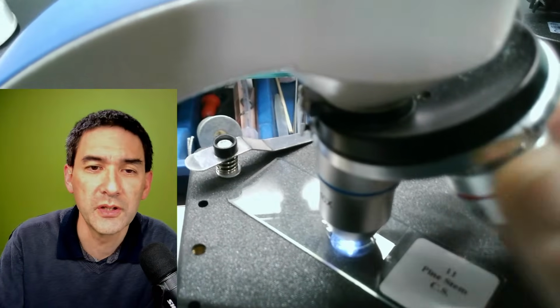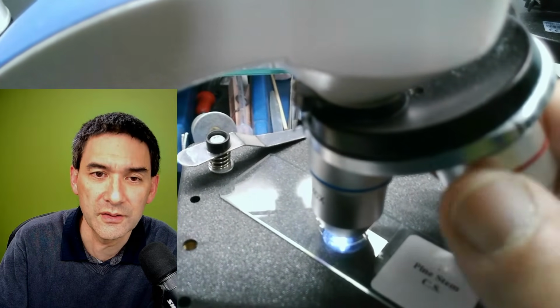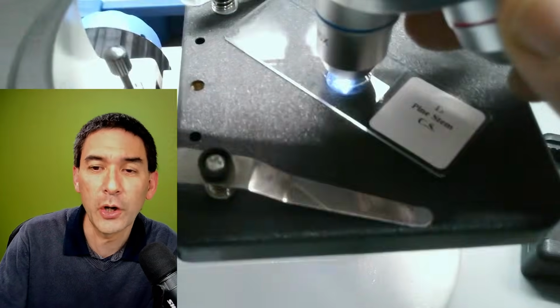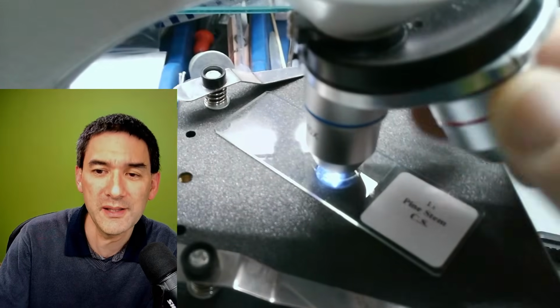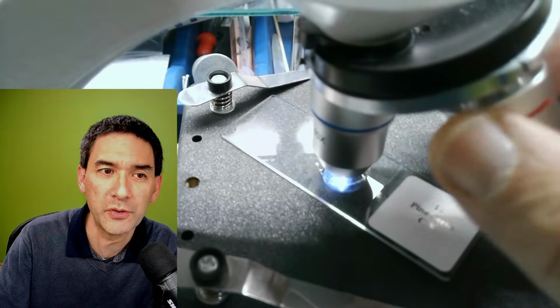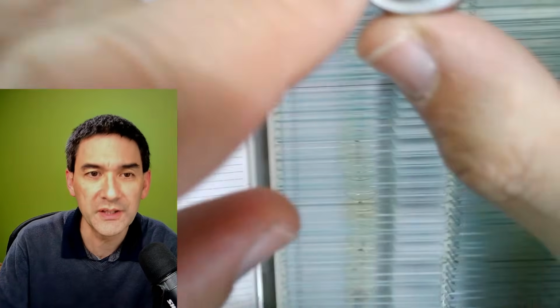When I was at university many years ago, these microscopes did not exist. So quite a lot has happened over the last several years. These are not RMS. RMS is from the Royal Microscopical Society. The optics are way smaller, and also the diameter.